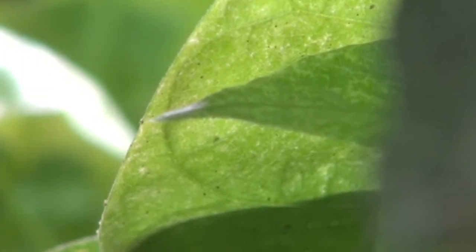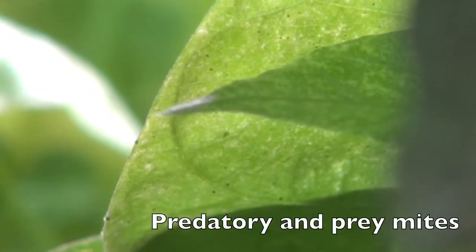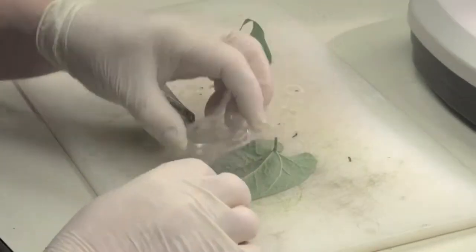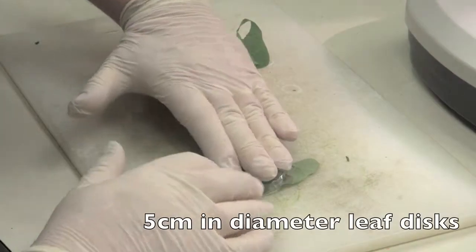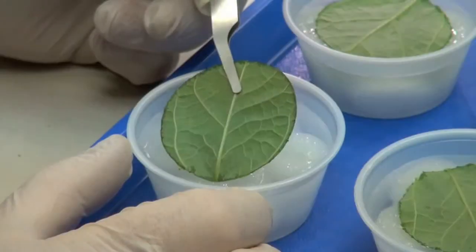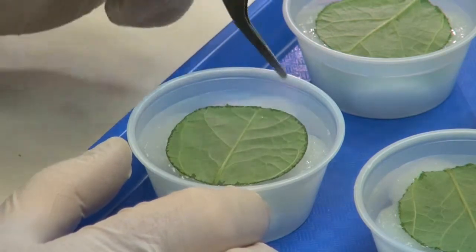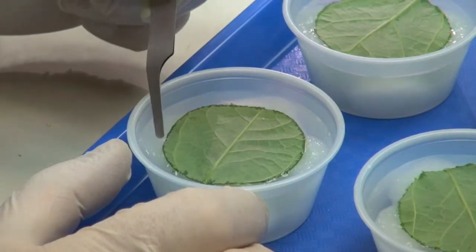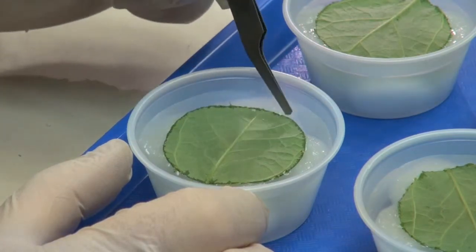For these bioassays, you will need to use groups of adult and immature mites of a known age. To do this, we start by cutting discs from bean leaves using a plastic petri dish. The leaf discs are then placed in a plastic deli cup containing cotton balls and water, with the underside of the leaf disc facing up.